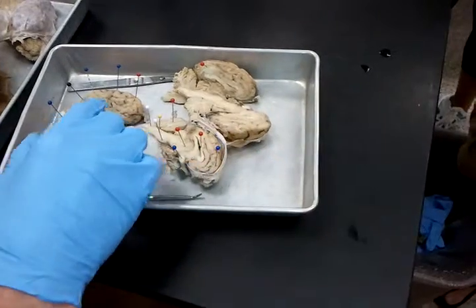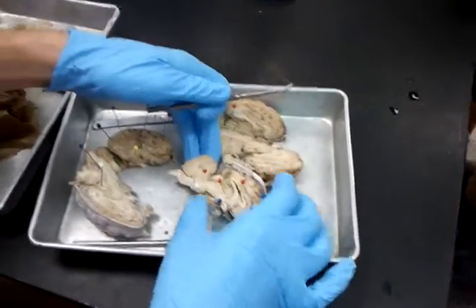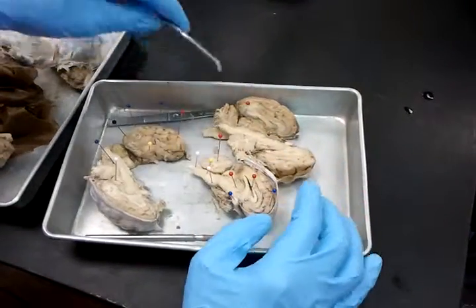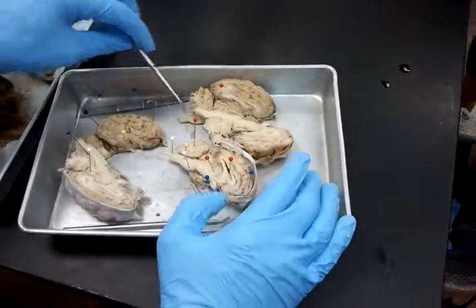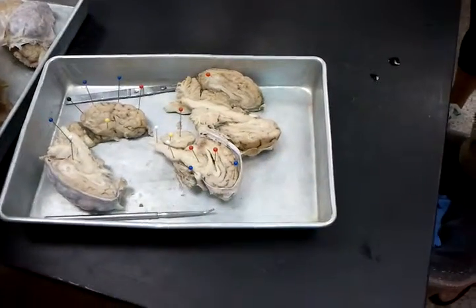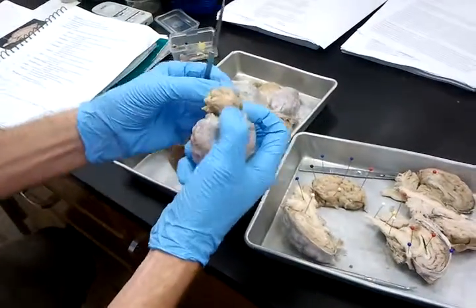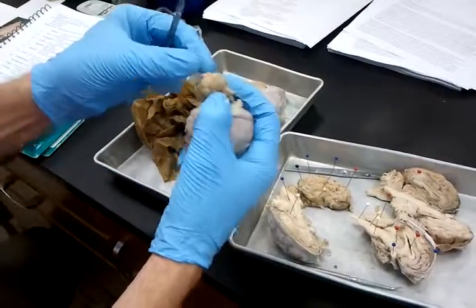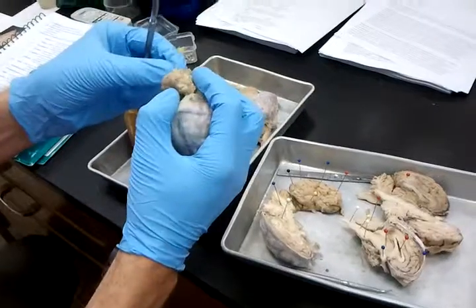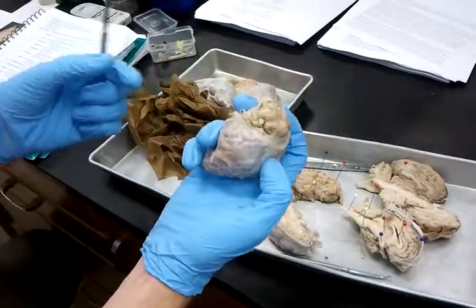Alright, cerebellum. So what I have pinned right here is the arbor vitae, and it means like tree of life or something to that effect. So if I have a dissected brain out, I have it pinned right there. I'm asking about the arbor vitae. Okay. I'll probably have a whole brain to ask about the cerebellum. So that structure back here is the actual cerebellum. I'll just have a pin in it and say, what is this? Right. It's all mangled, but know that that's the cerebellum.